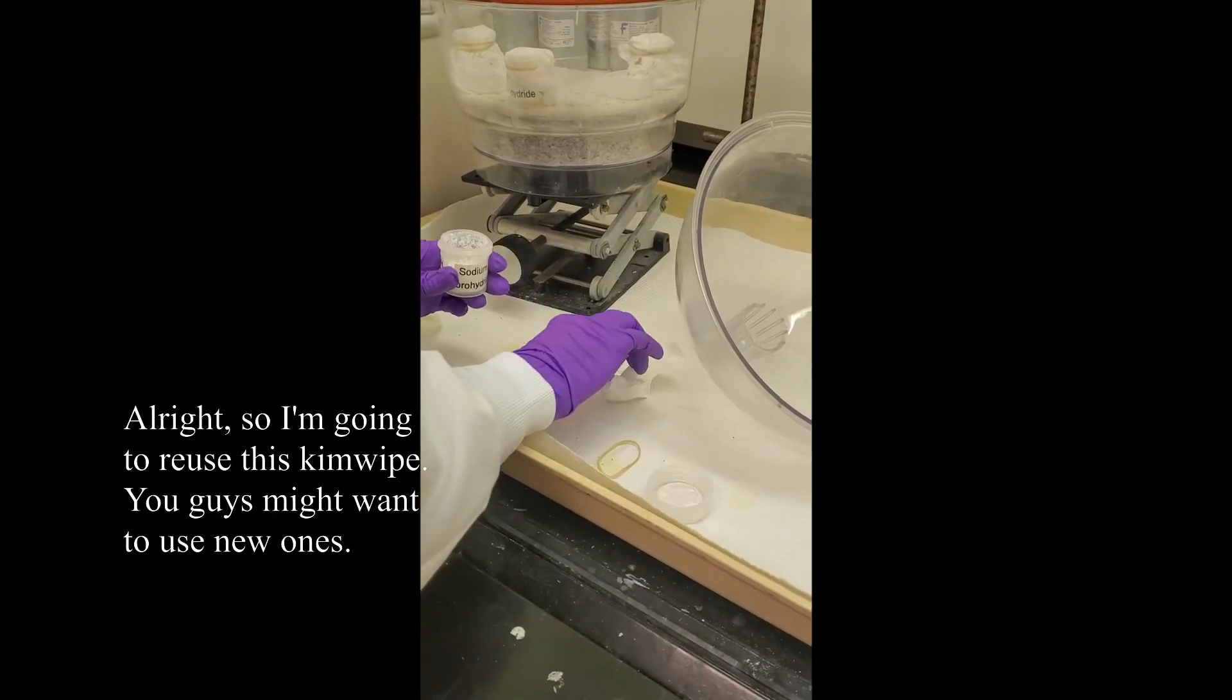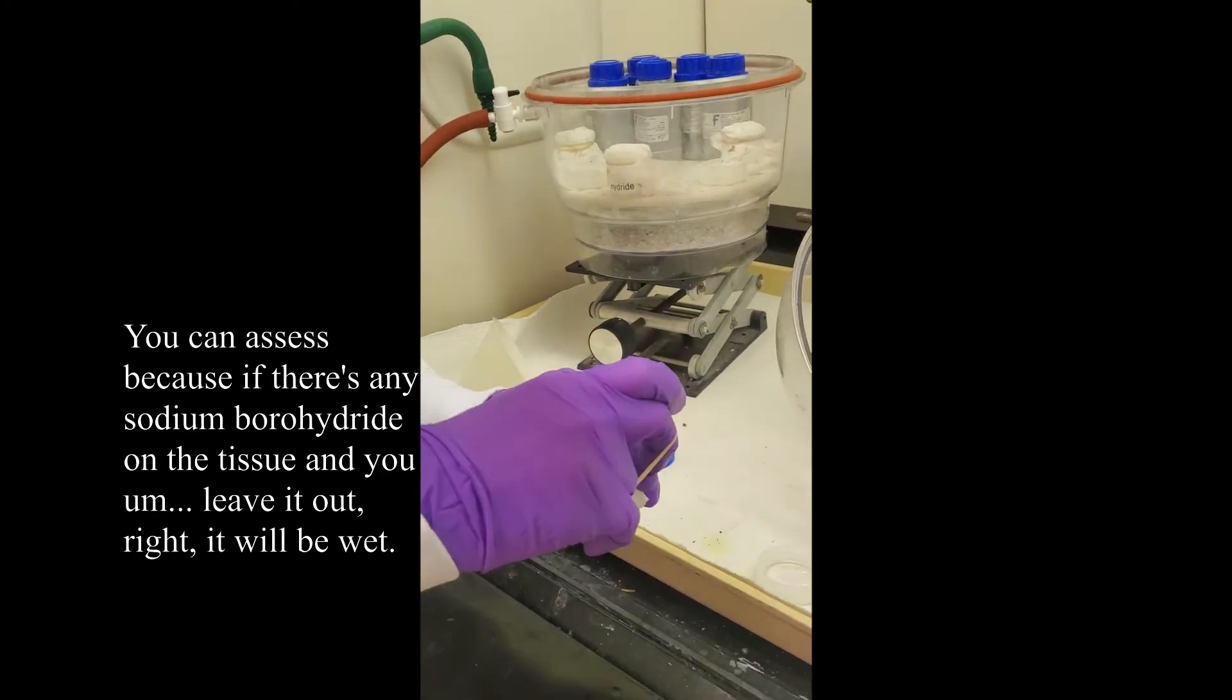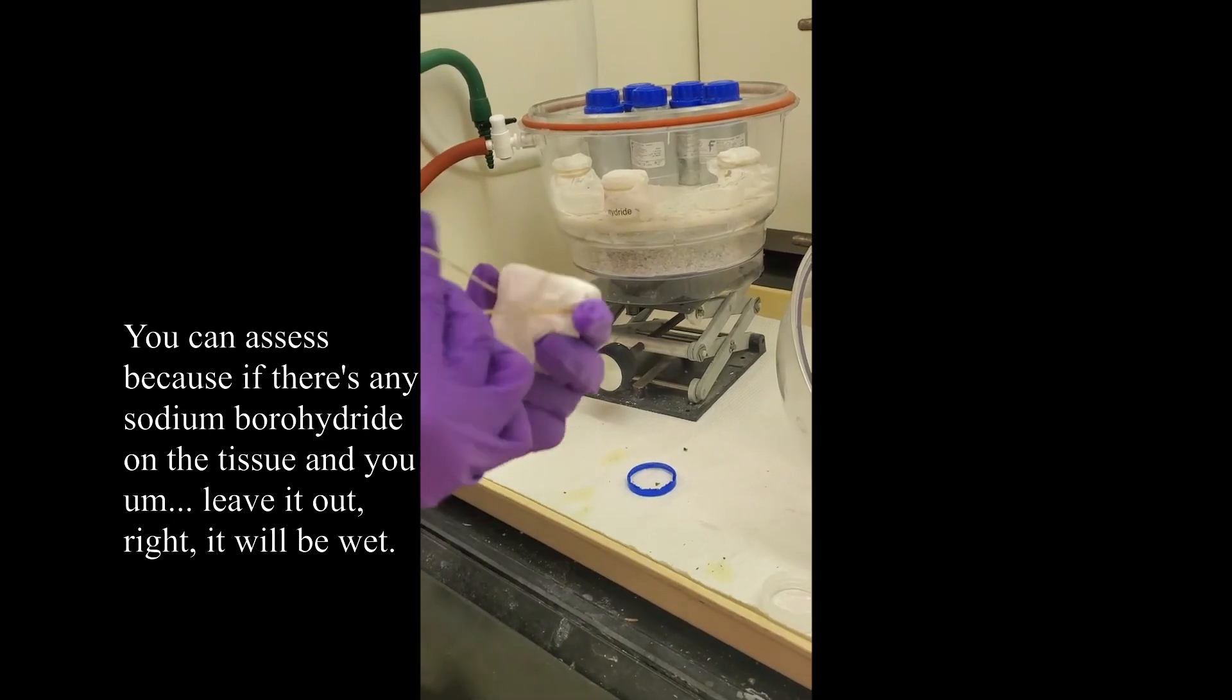So I'm going to reuse this Kim Wipe. You guys might want to use new ones. You can assess because if there's any sodium borohydride on the tissue and you leave it out, it will be wet.